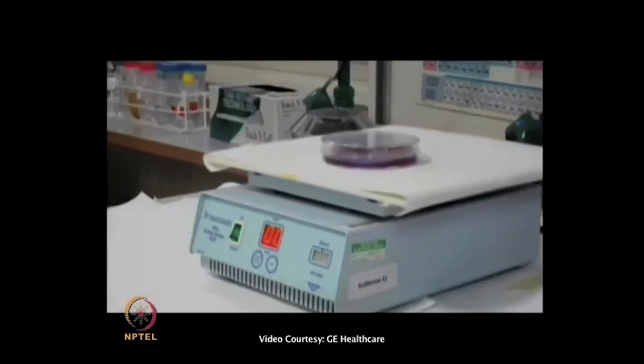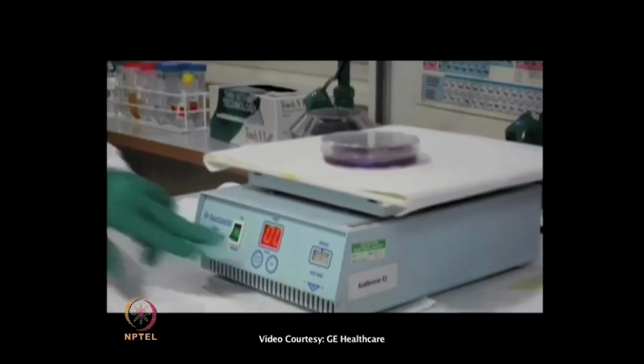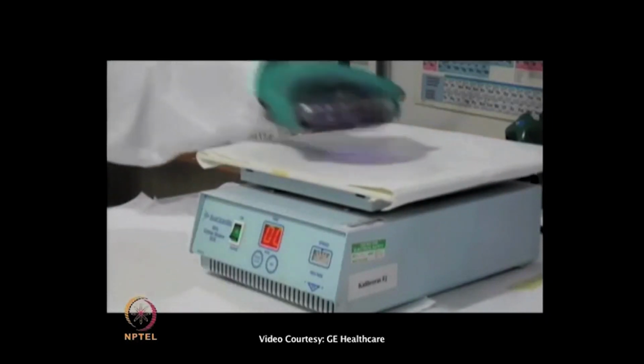After the isoelectric focusing, the strips are removed and equilibrated in SDS-containing buffer in 2 steps, using DTT to reduce the disulfide bonds of cysteine residues, followed by alkylation with iodoacetamide to avoid modification by acrylamide.